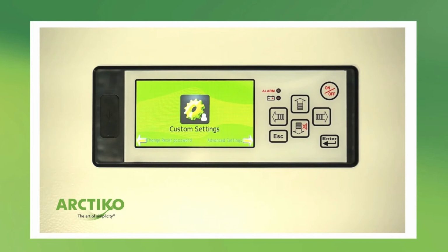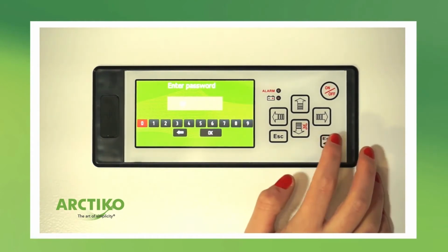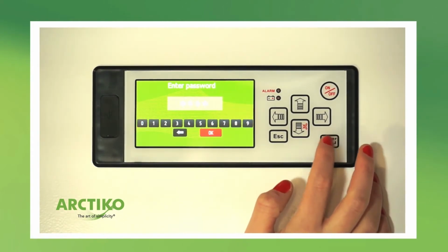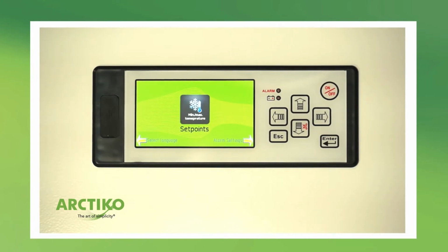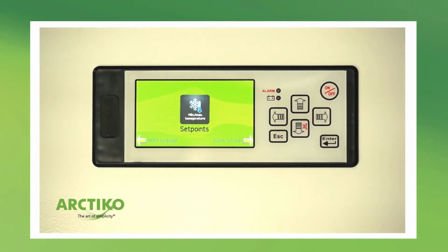Press Enter to go to the menu. Enter the password in order to access the custom settings menu. The password is 0000. Here you see the set point menu, where you can set the temperature you want the unit to run at.